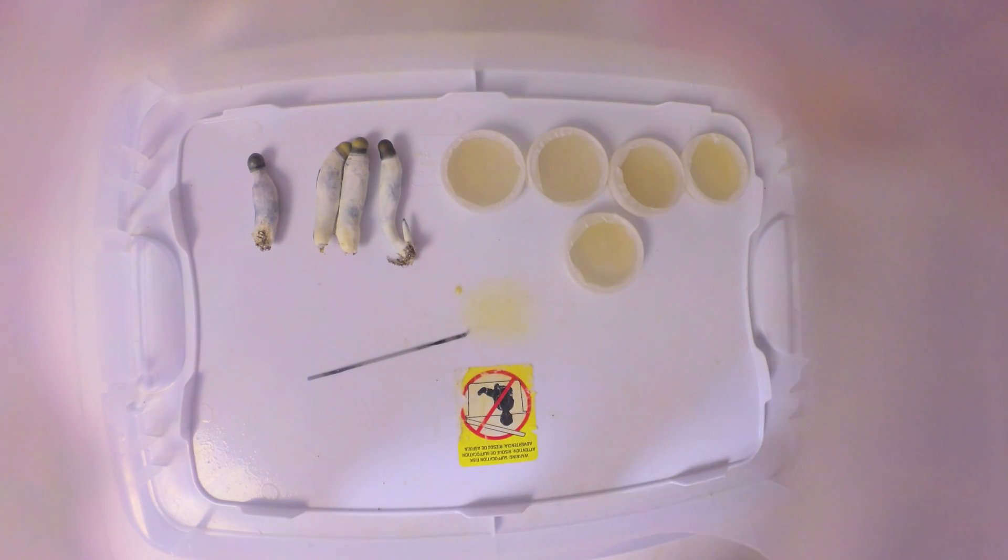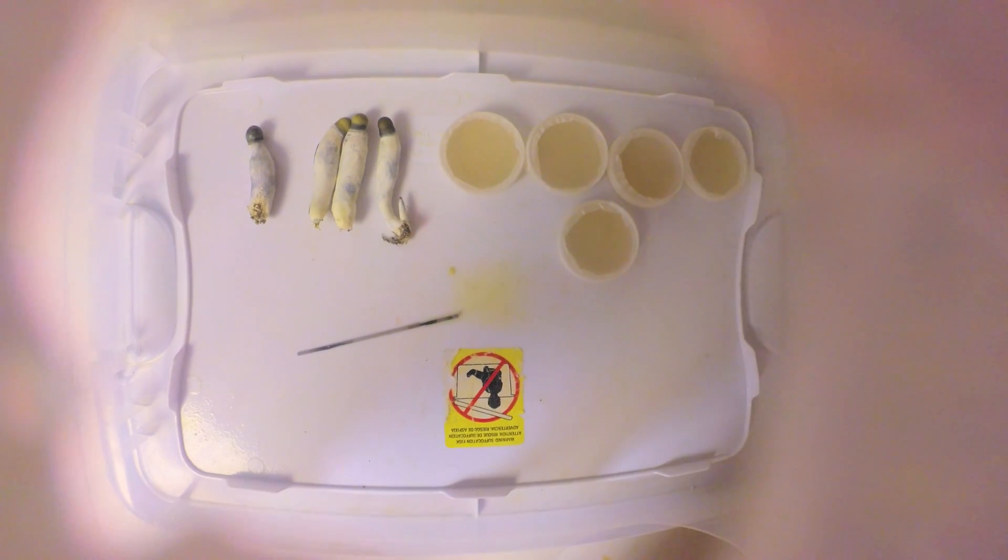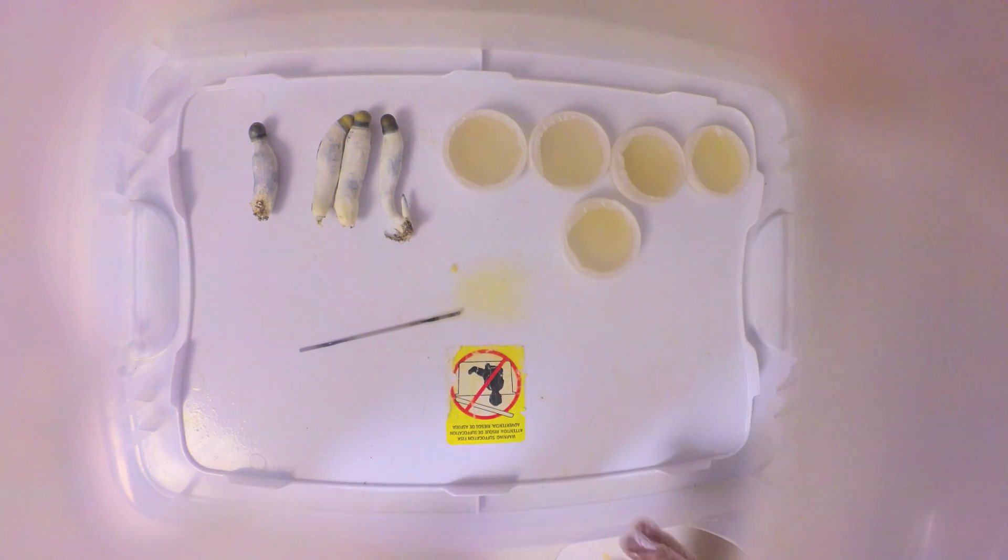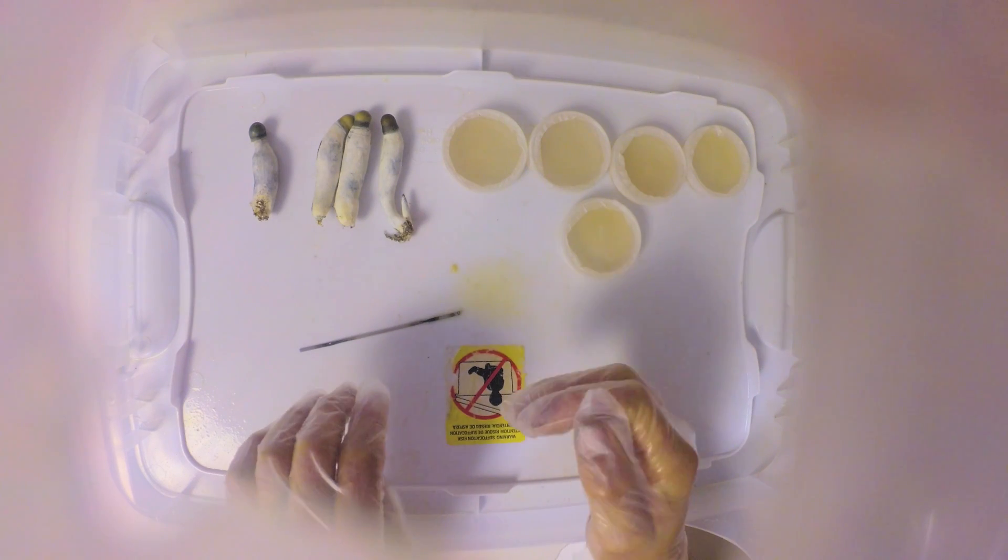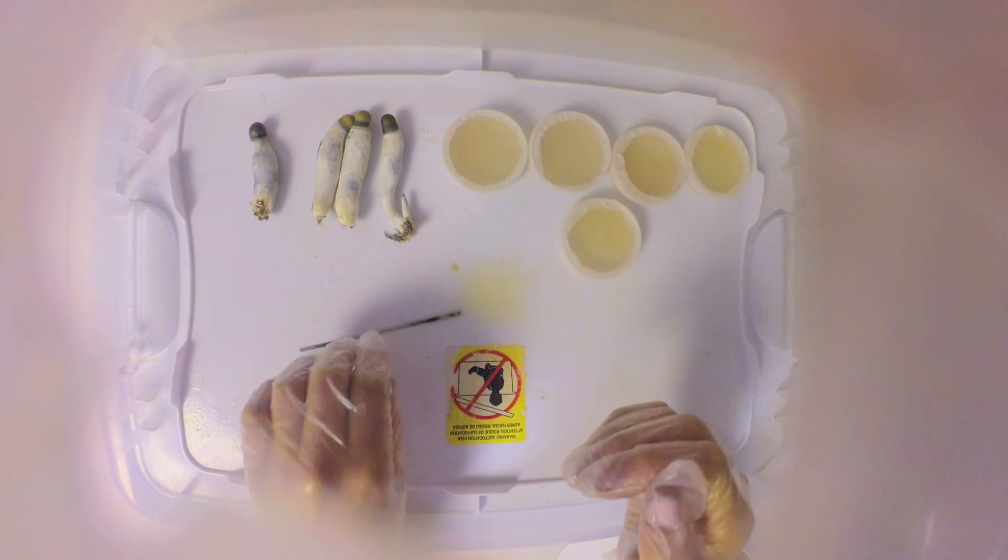What's up guys, MegaDogs here. In the last video I poured some agar dishes, just gonna make a quick video going over how I inoculate them.